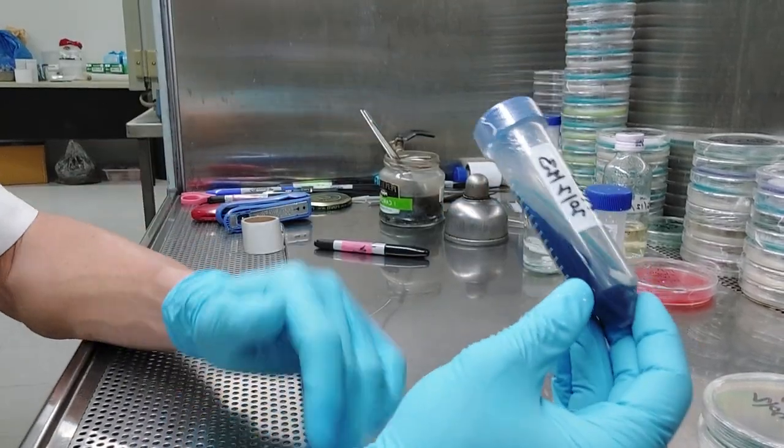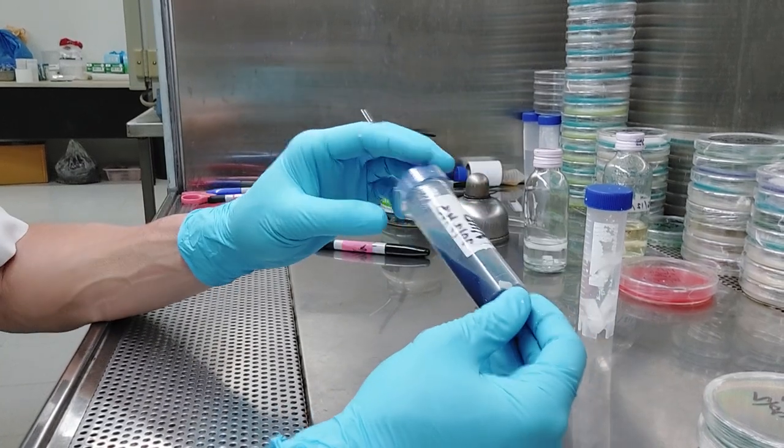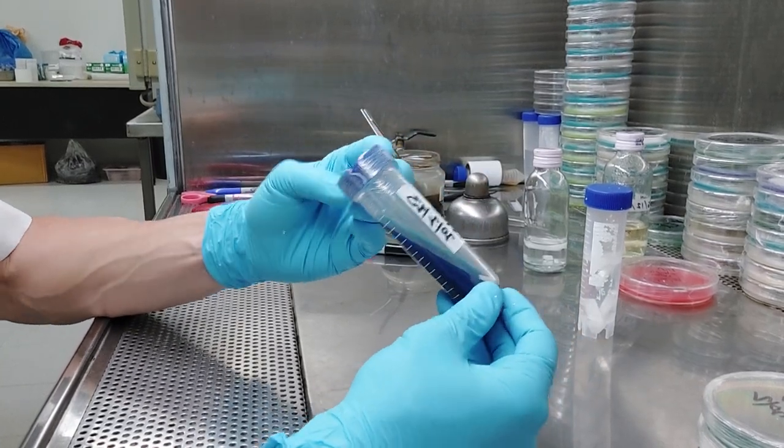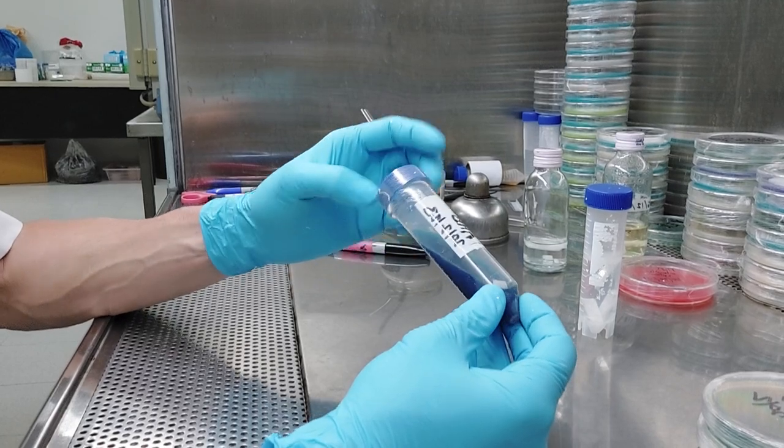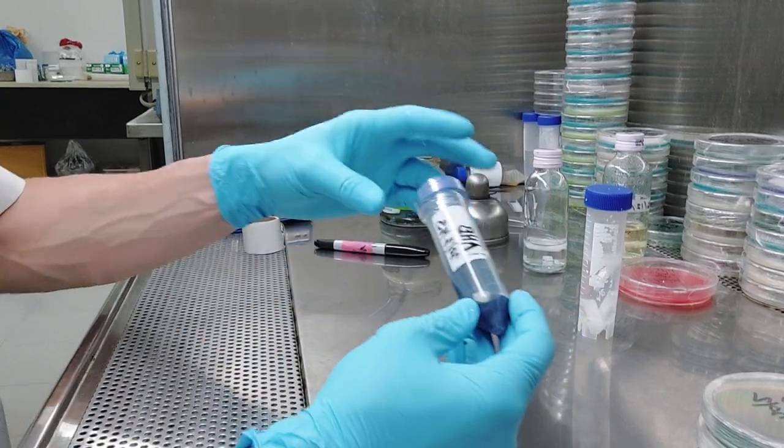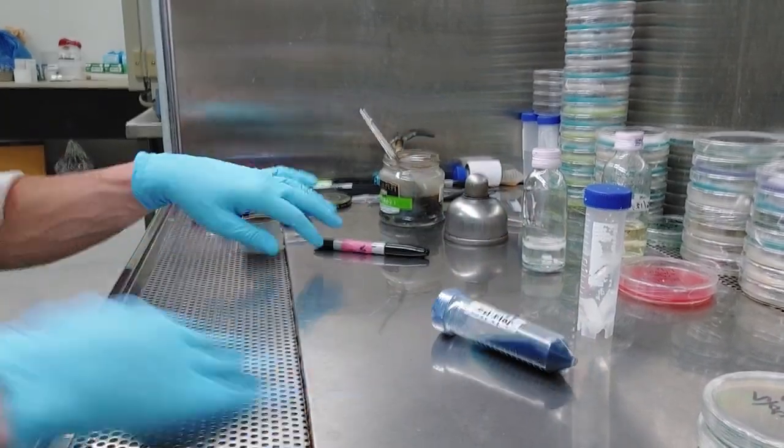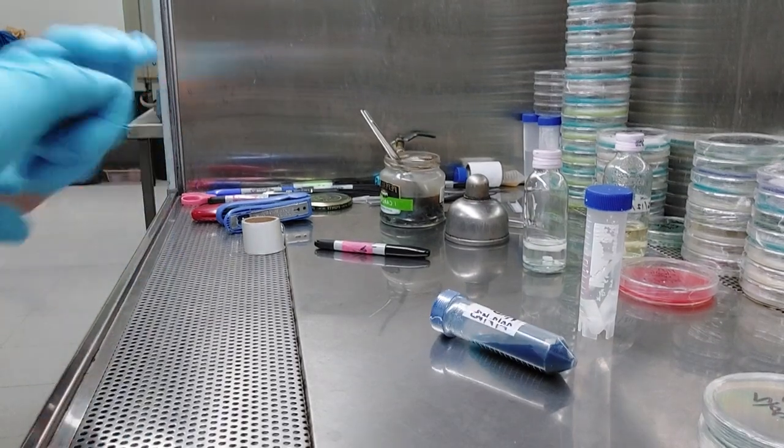The upper part will be easier to deal with. So when you're taking things out of these slants, you're going to start working from the top. So there's some different kind of ideas that will be older towards the bottom, which, you know, maybe you want older. It depends on who's kind of theory you believe when it comes to senescence. Anyway, we'll talk about that. That's a whole other like six videos. Anyway, label properly guys. I think that's it because I'm approaching the 17 minute mark now.